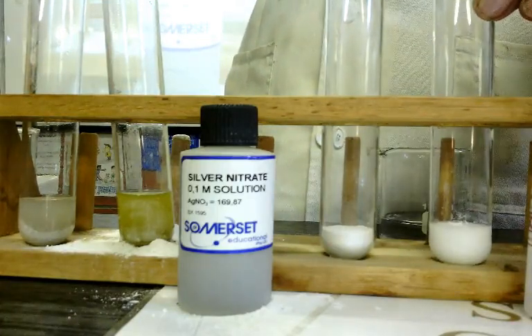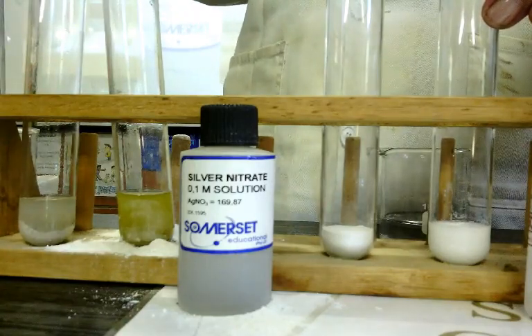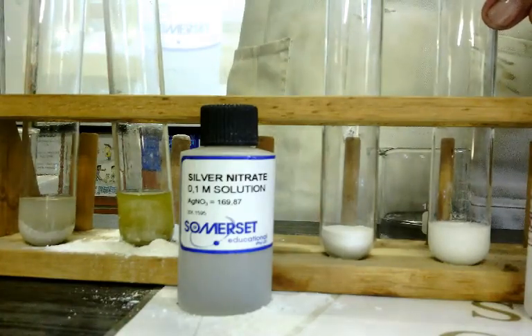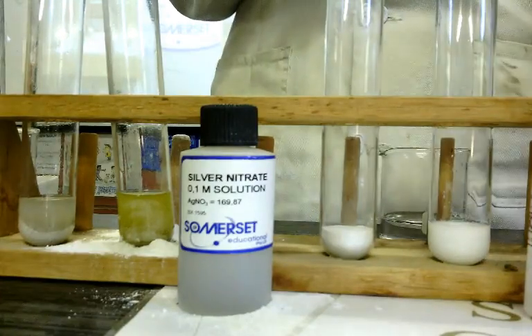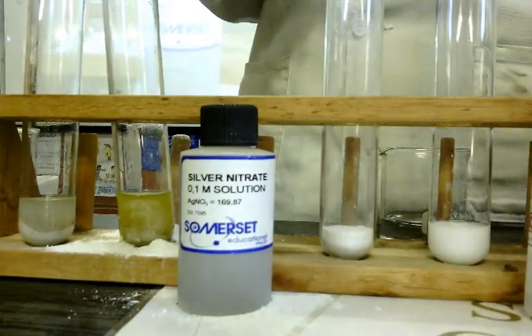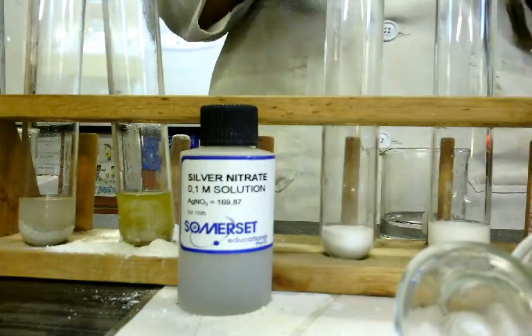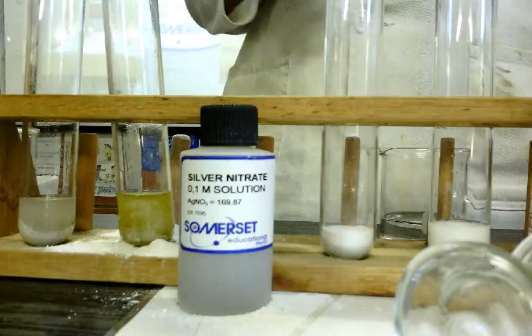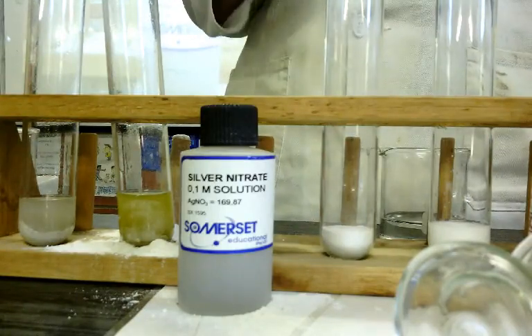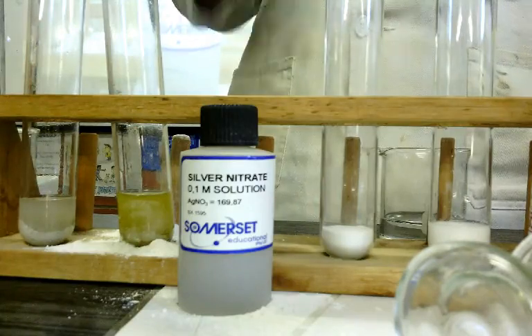Now with this one, you can measure the rate of the change in mass, or, and we're going to do it here, we can measure the volume that is formed. So I'm going to, you happy with that? So the 4 factors: concentration, state of division, temperature, and nature of the reacting substances.